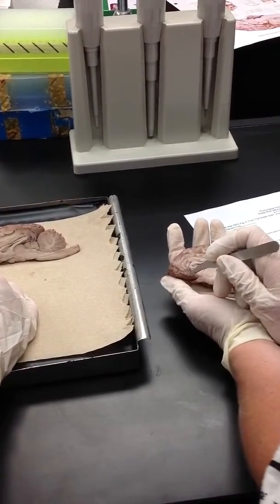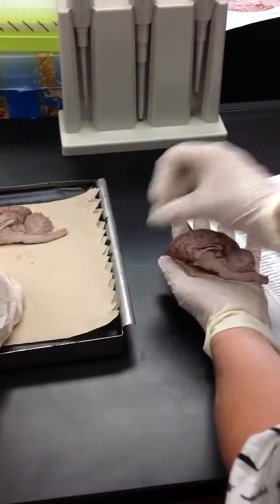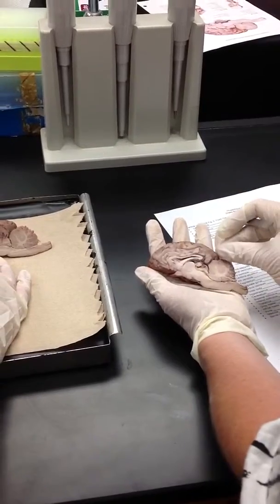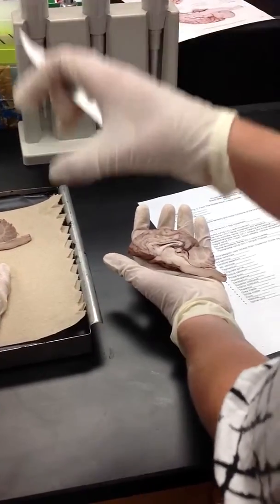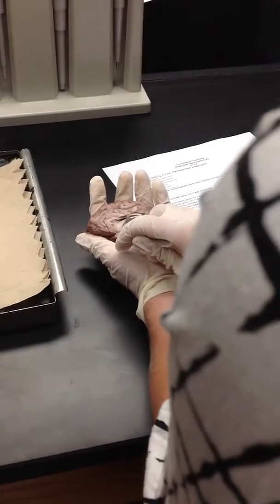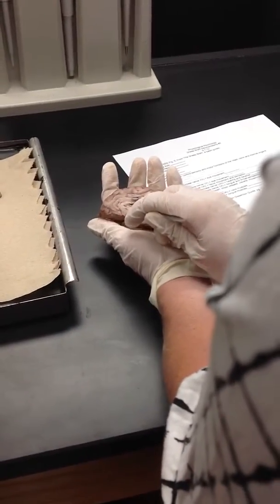Remember, we were talking about the forebrain, right? So the forebrain includes the cerebral hemispheres and the cerebral cortex, that's the thin layer of cells. But we also talked about it having the limbic system and limbic cortex being located deeper, subcortical, and more in the central area. And so this is the cingulate gyrus. It's an example of limbic cortex.